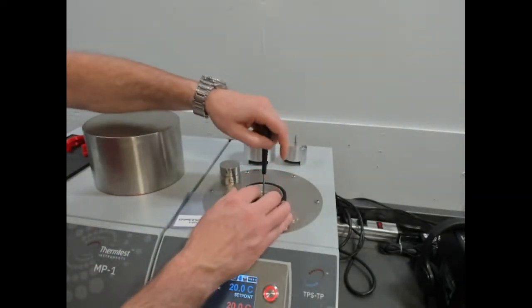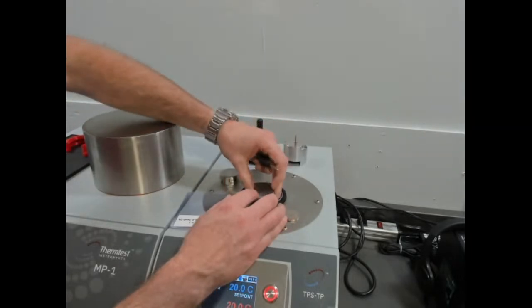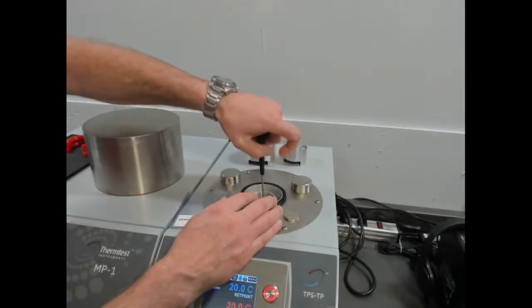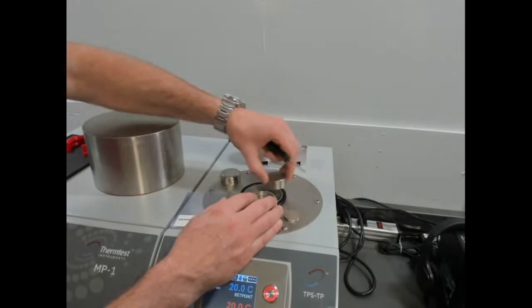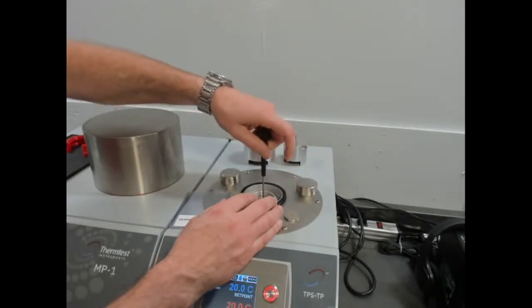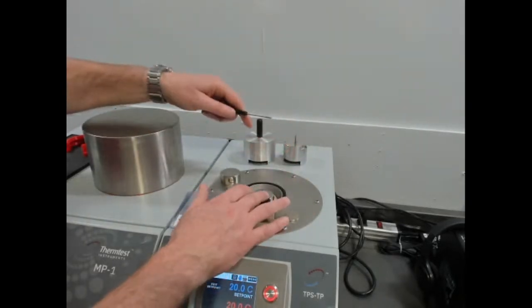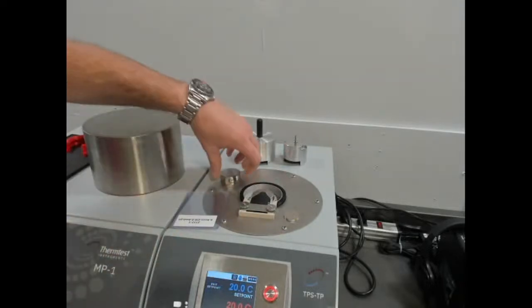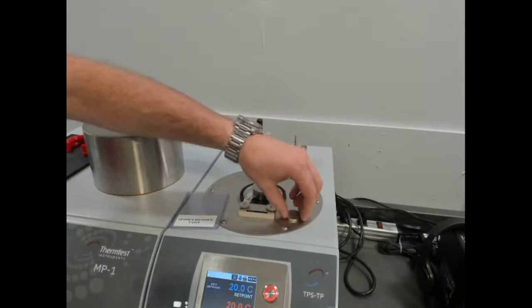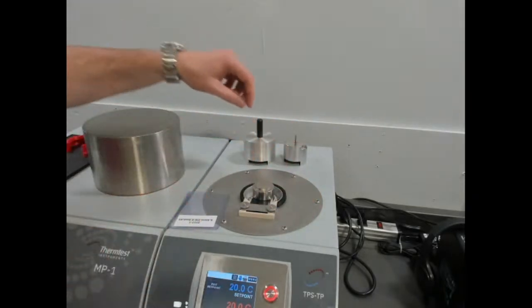We'll lower the platform so that we set up symmetrically, so when we place our sample, it's sitting parallel to the sensor. A little bit more. So the floor can go up and down. The maximum sample size inside the temperature platform is 40 millimeters diameter by up to 20 millimeters in height. And you can measure inside here symmetrically or asymmetrically, so two-sided or single-sided.